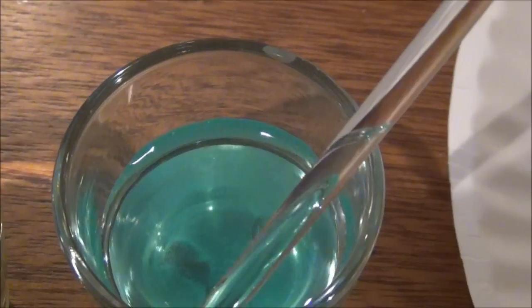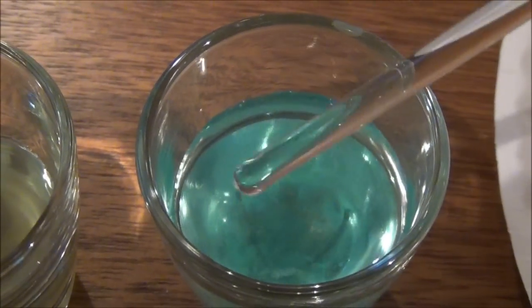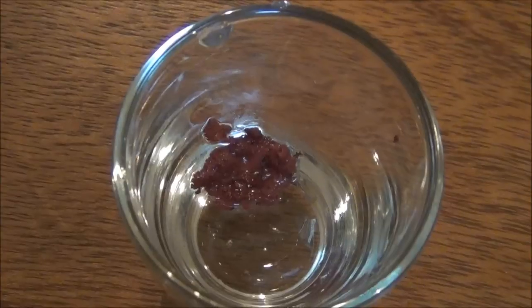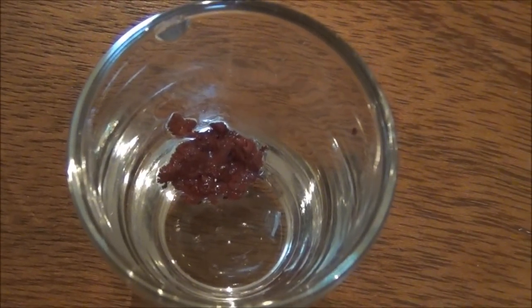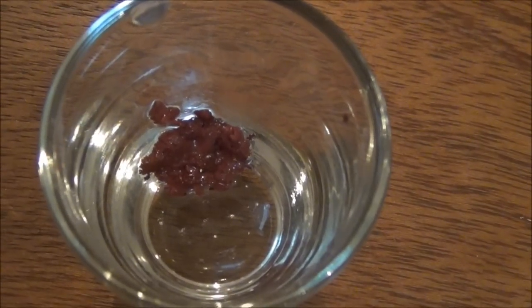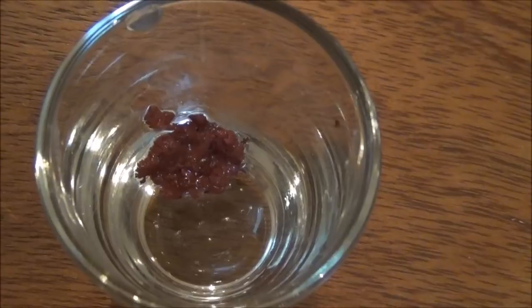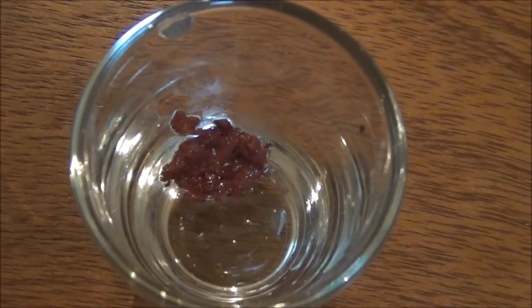And then we move on to our last shot glass which contains the copper wire. The copper wire appears to be relatively unchanged. So if I remove the residual aluminum and any of the copper two sulfate solution that's left unreacted from the shot glass, you can see the reddish brown solid copper metal that is now in each of the shot glasses with the exception of the one that contains the copper wire.